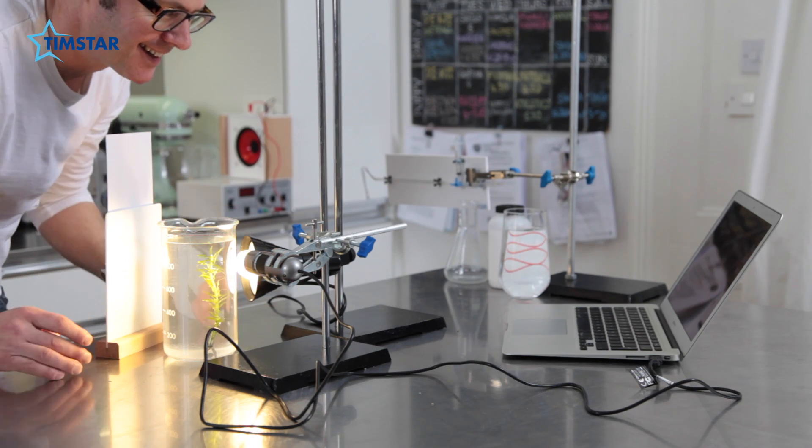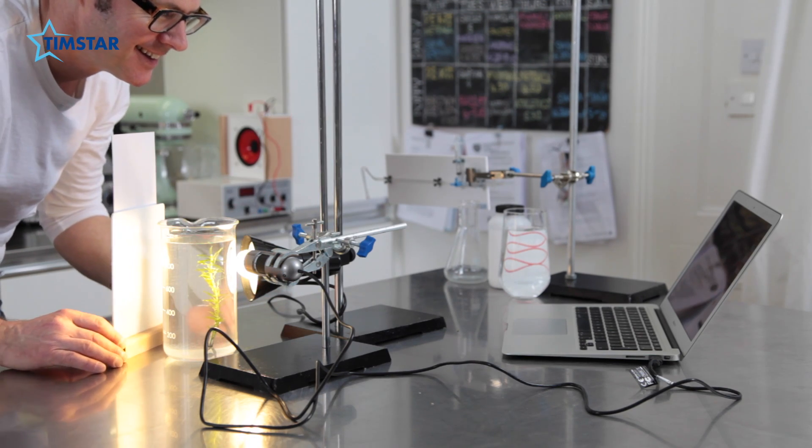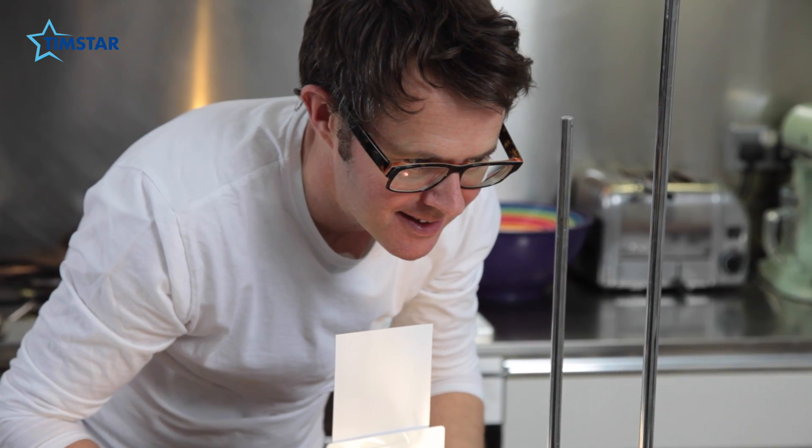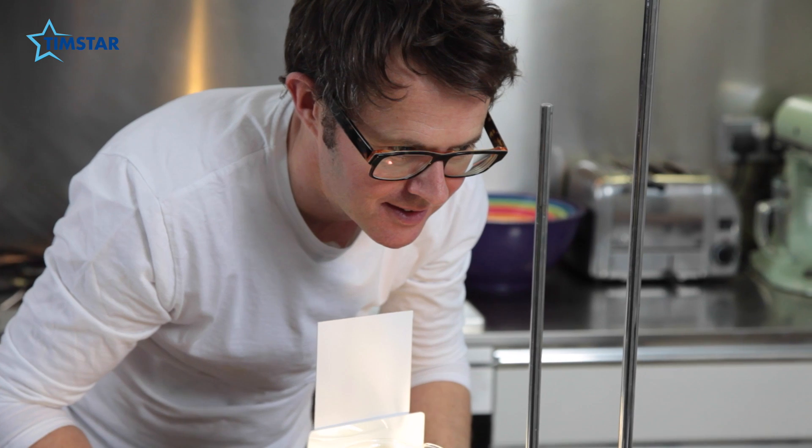This is a USB microscope. And when you start playing with this and looking at something really small, it kind of blows your mind. And that is a thing of beauty.